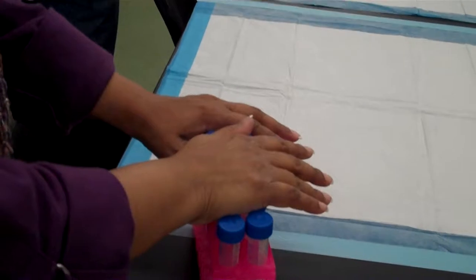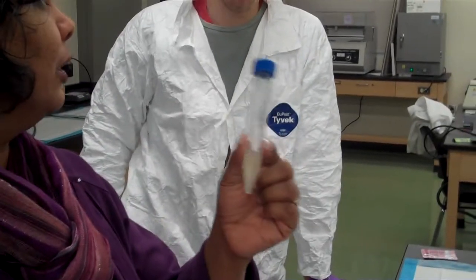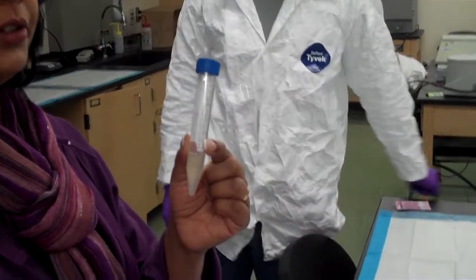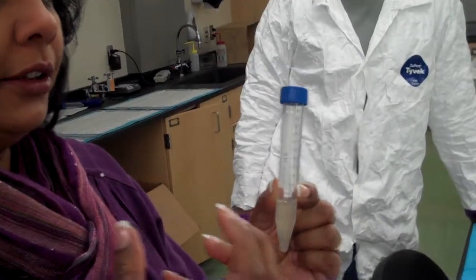So our goal in this step is to get all those cells that grew. The material that you put in yesterday has grown into all these cells. Our goal today is to get all of these cells out of the broth. To do that, we're going to use a centrifuge. A centrifuge simply works by spinning the material really hard, and the heavier material settles to the bottom. It's a little bit like your washing machine in the final cycle, how your clothes all get stuck to the side of the washing machine. It's the same idea. We're using centrifugal force.